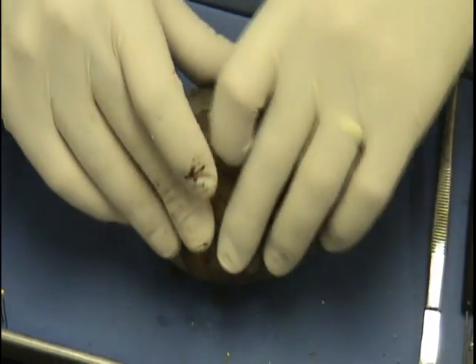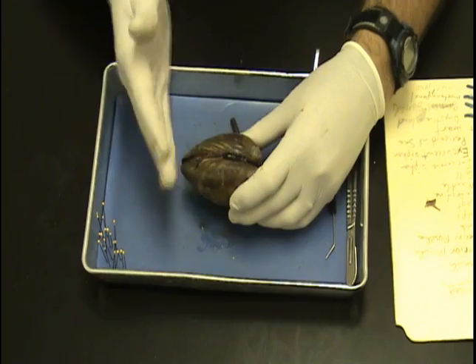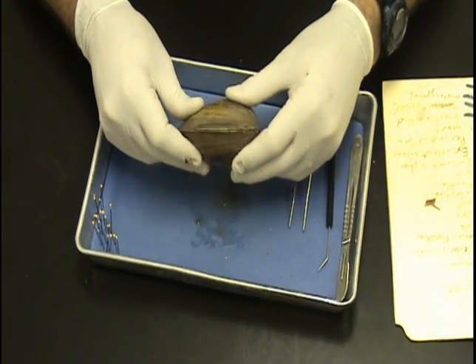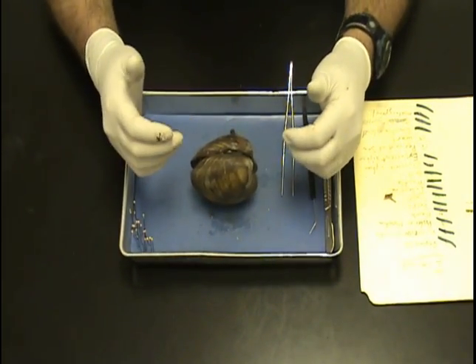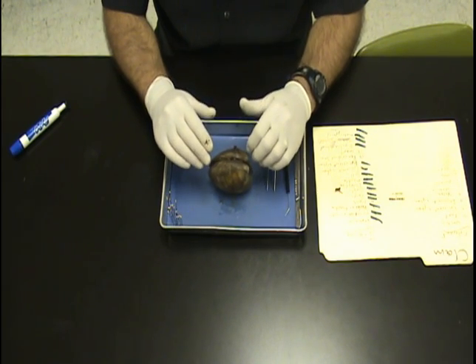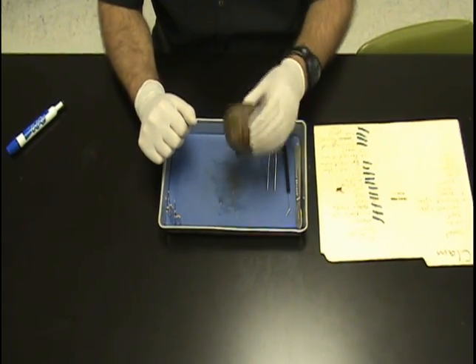Let's go over the external anatomy. Where the umbo is: anterior. Opposite to the umbo: posterior. Where it hinges together: dorsal. The opening on the bottom side: ventral. This is a bivalve, also in the phylum Mollusca. Now we're all finished — we want to clean up our station and throw this away. You may not keep the valves; they will go in the garbage. You will study your notes, this video, and your PowerPoint, and take your take-home quiz. Good luck, and I hope you enjoy the wonderful world of Mollusca!